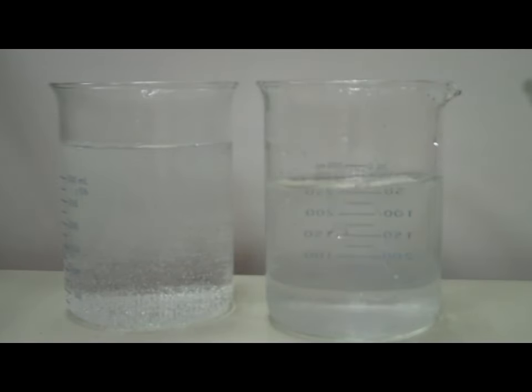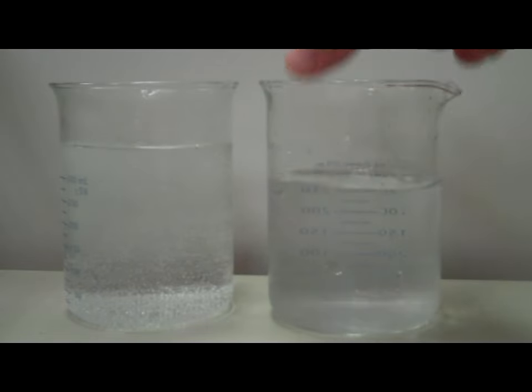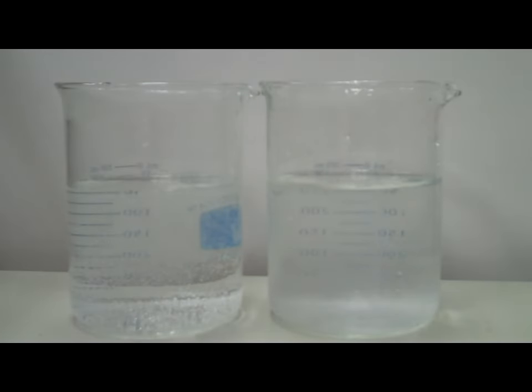Now notice that we have more of the hot water, so I'm going to take some of this hot water and pour it out. Remember, we don't want the amount of liquid to be a variable, so I'm just going to pour some of this off until we get it roughly the same. Okay, I would say that's roughly the same.